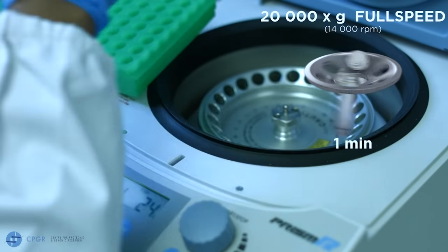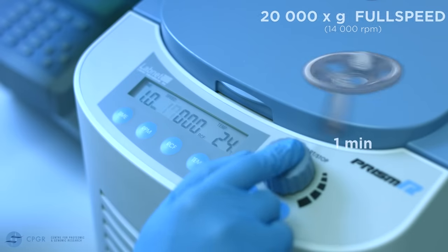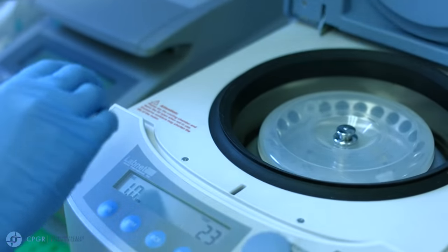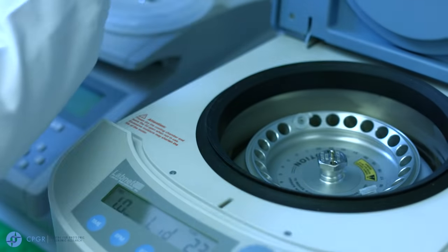Centrifuge at full speed for one minute. This ensures that all residual wash buffer and ethanol are removed, which could affect downstream processes.